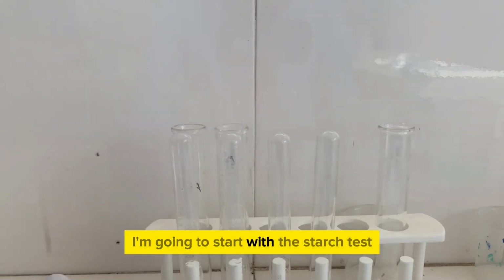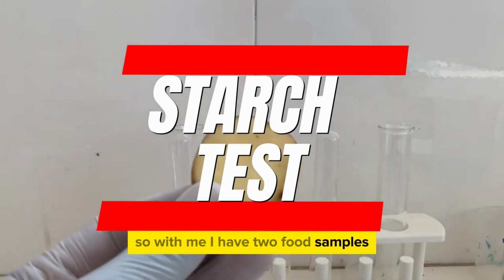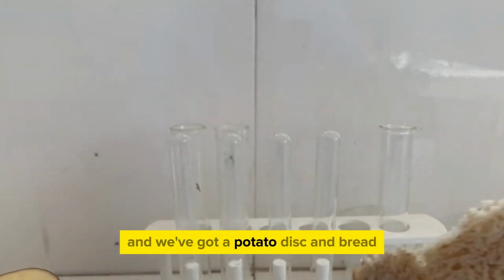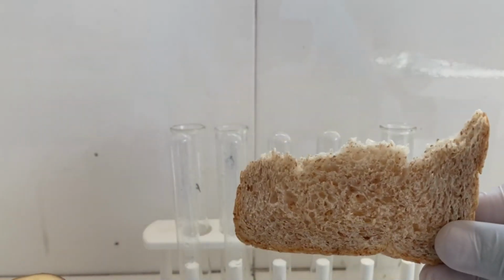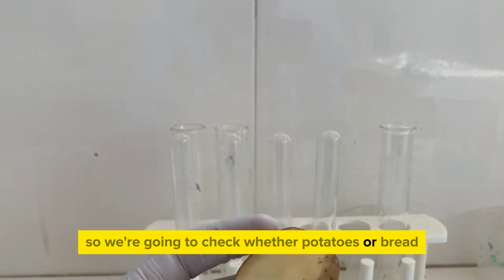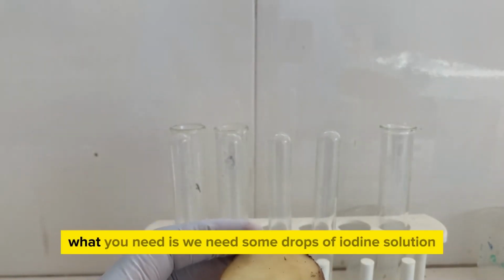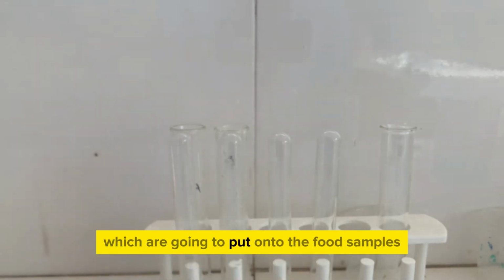I'm going to start with the starch test. So with me here I have two food samples. We've got a potato disc and bread. So we're going to check whether potatoes or bread have got starch. What we'll need is some drops of iodine solution which we're going to put onto the food samples.